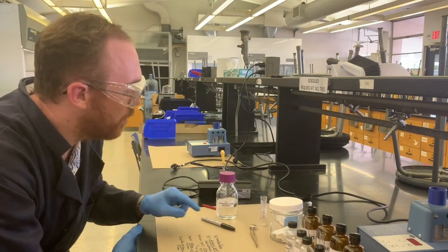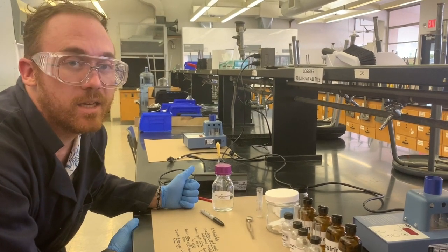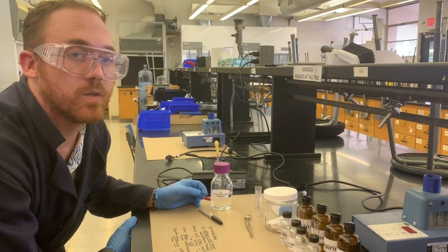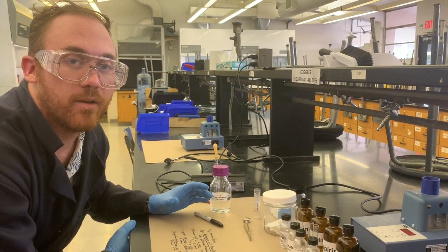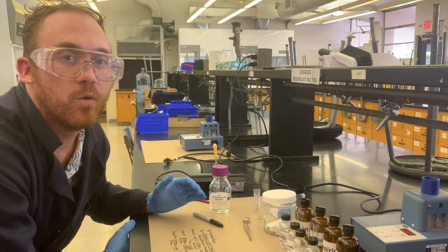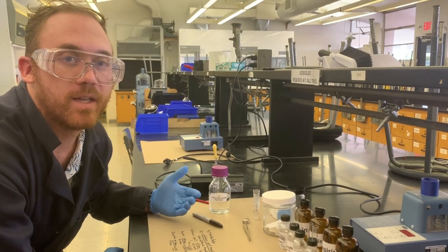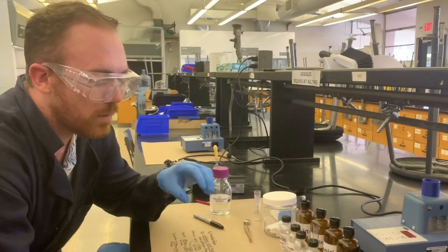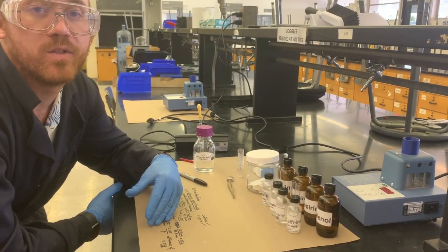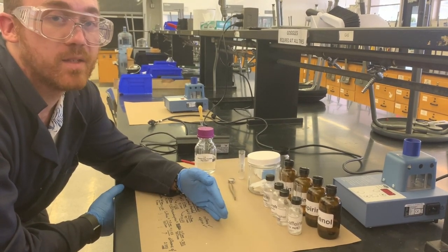As soon as you change the blend, from 1 to 3 hexane ethyl acetate to say 1 to 6 or 1 to 18, depending on what runs best for the sample, you're going to get different results. That could enhance a result. You could get better separation with a different blend, or you could get worse separation. Maybe the solvent front won't move any of the compounds at all. If it doesn't move the compounds, it's probably a good sign that your solvent isn't polar enough. And if it's not polar enough, then you're going to have to increase the polarity so that the samples can move relative to the silica base up the TLC plate.